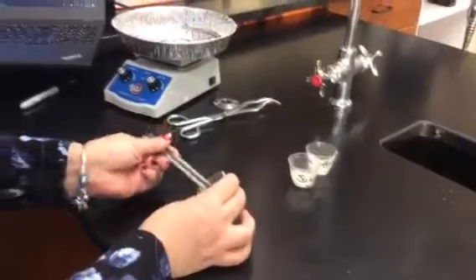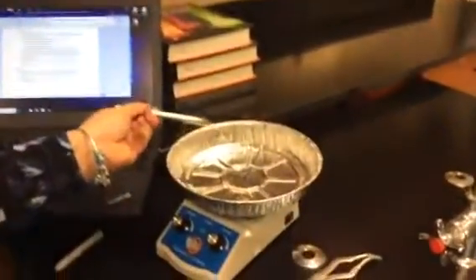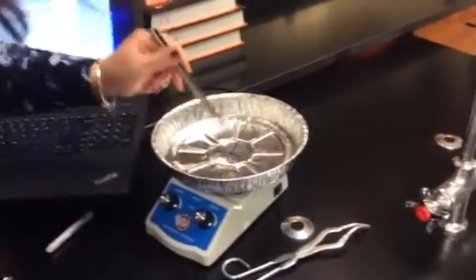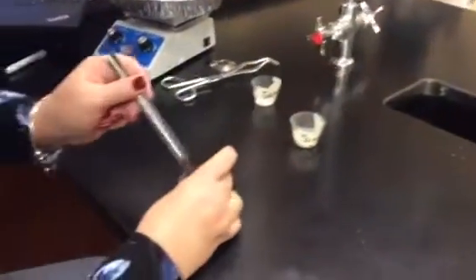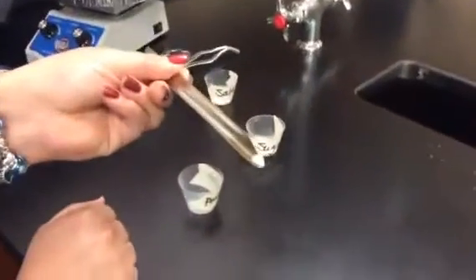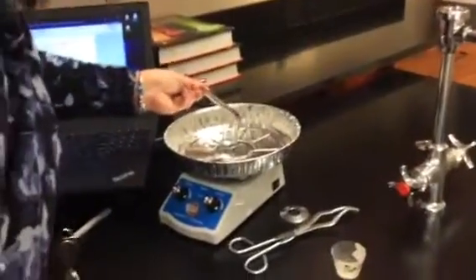All right, and then salt, same thing as sugar. You're going to put this into B. Great. And then clean it off. And then finally paraffin. You should have a nice little chunk like that, and then you're going to put that into wedge C. And that's a nice solid.